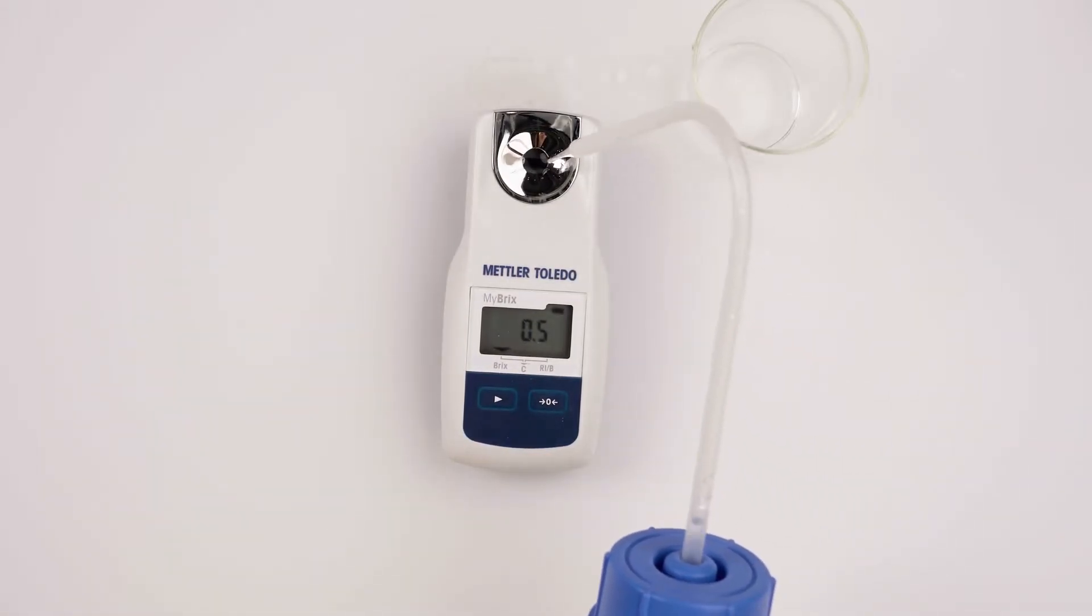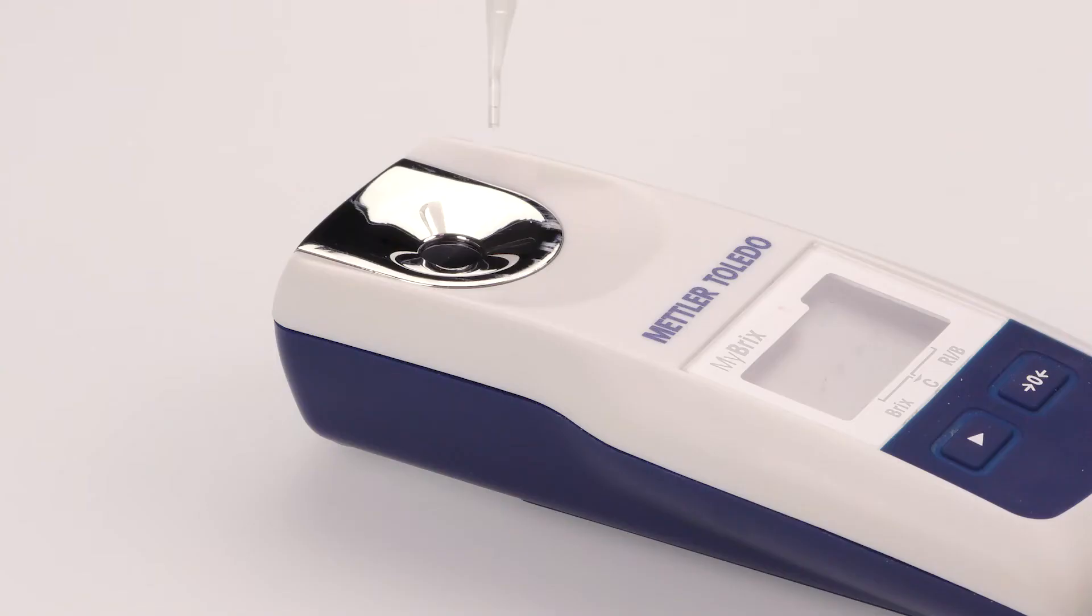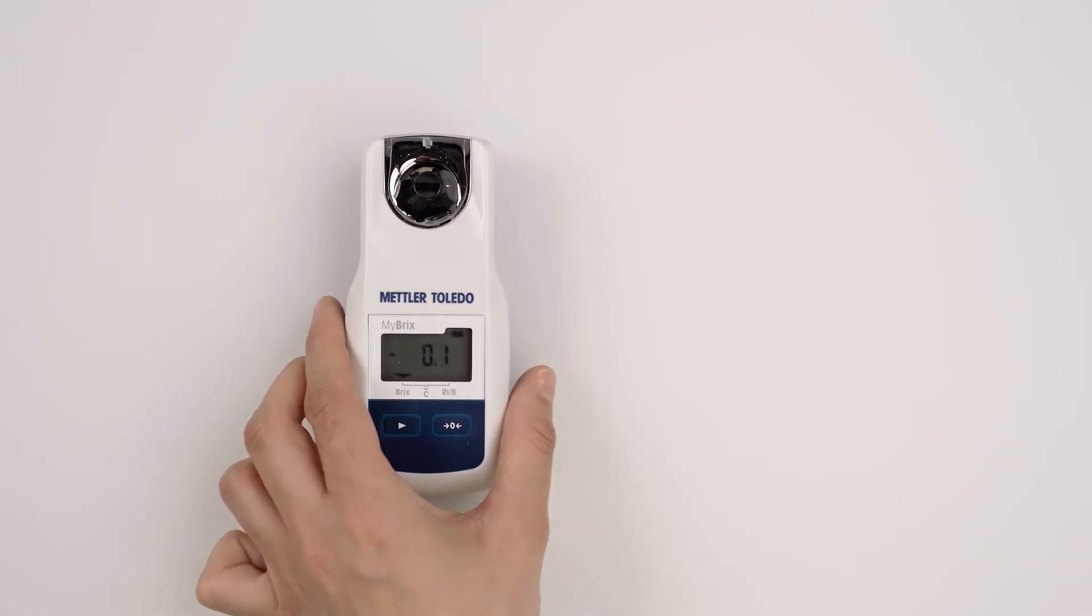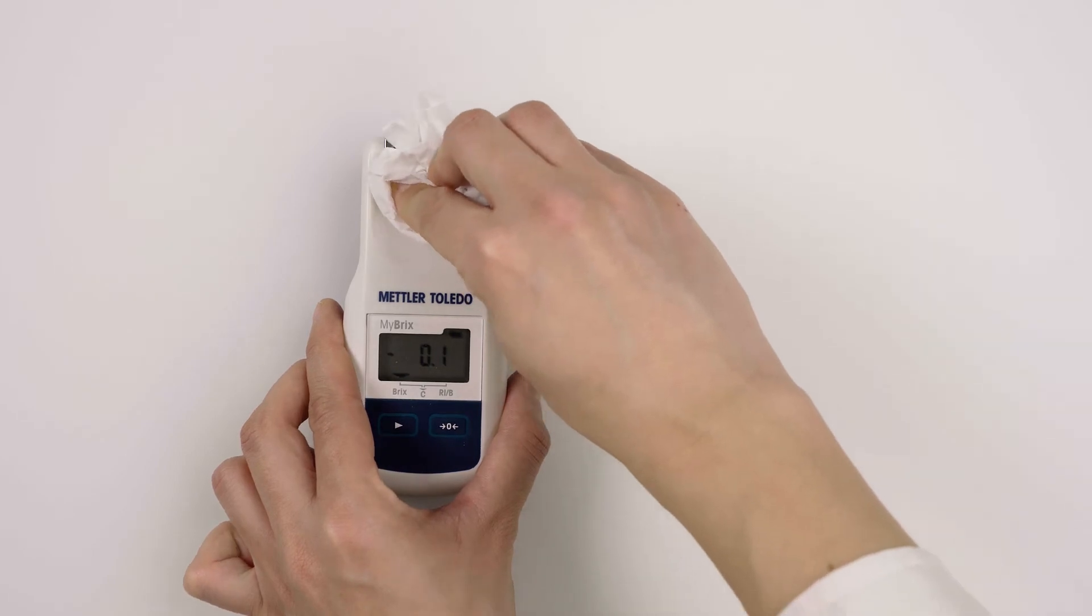Check if the instrument is properly cleaned by measuring pure water. Dry the instrument with a lint-free tissue.